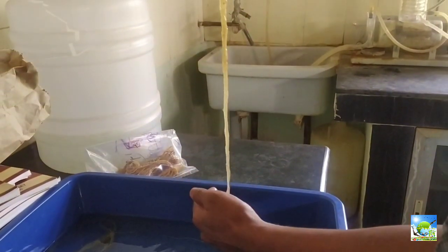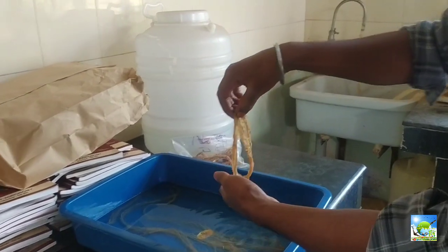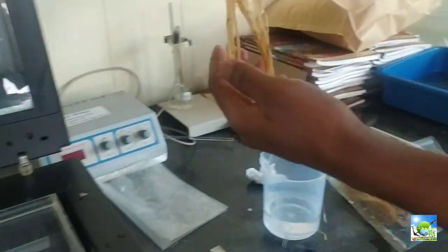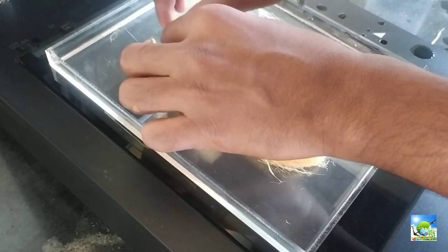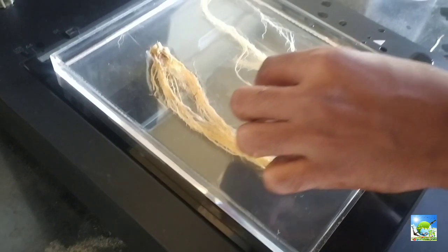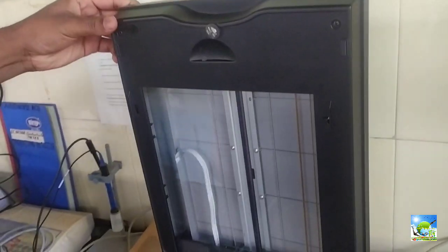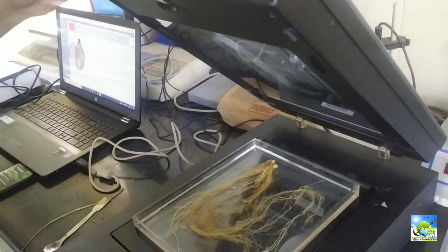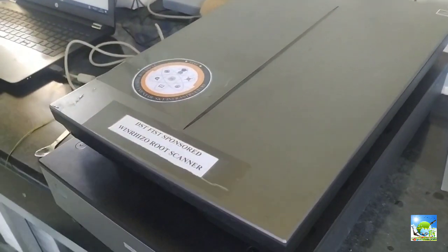Care needs to be taken not to damage the roots while washing, because minute roots may be lost during washing. For preservation of roots, they should be kept in a deep freezer at minus 20 degrees Celsius in a polythene cover filled with water. The connection of the root scanner should be given perfectly — switches should be on and the back-side lock should be unlocked.